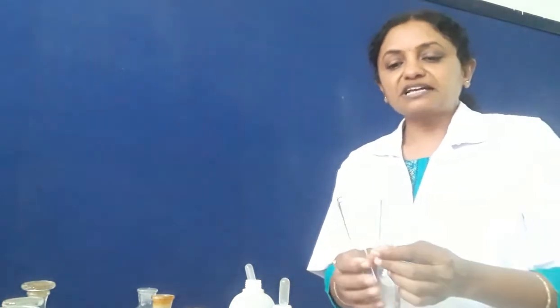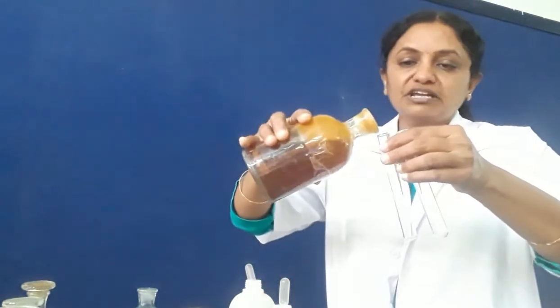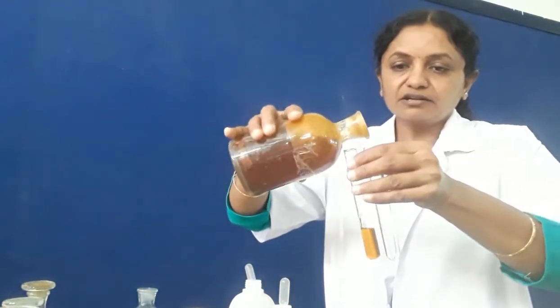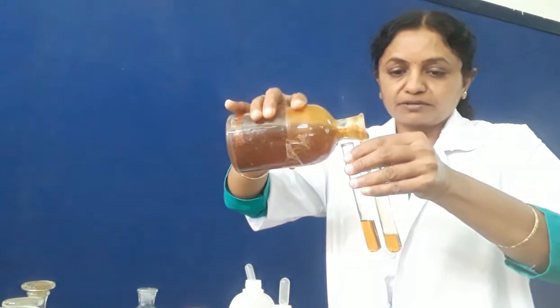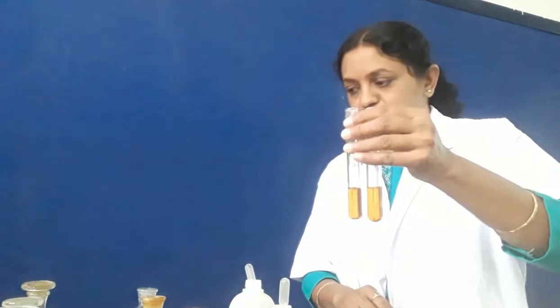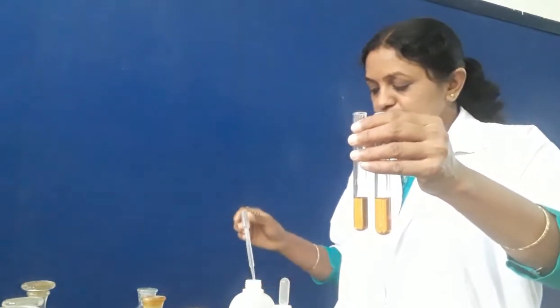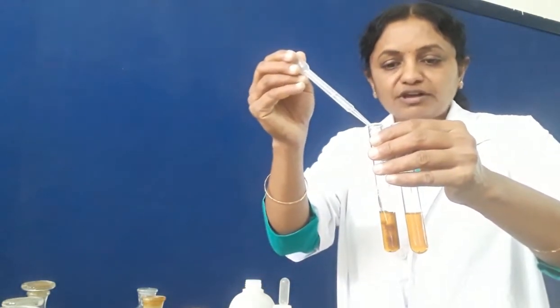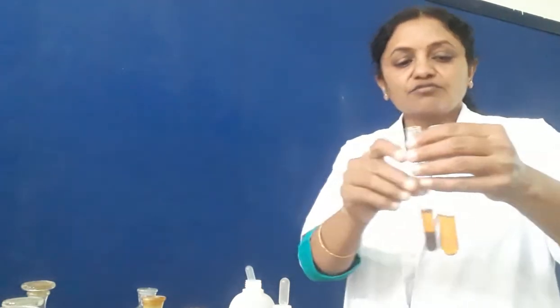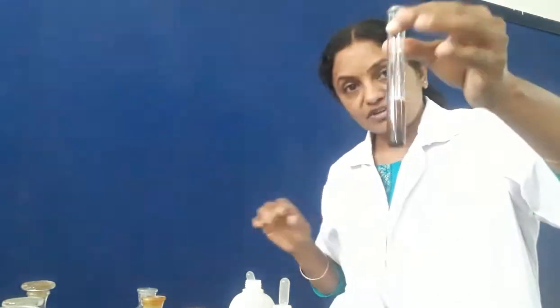Now we will take another two test tubes to detect the second salt solution — ferric chloride. We take ferric chloride in both test tubes. In the first test tube we add a little NaOH, and we see it is a reddish brown precipitate. We got precipitate — a precipitate is an insoluble solid.